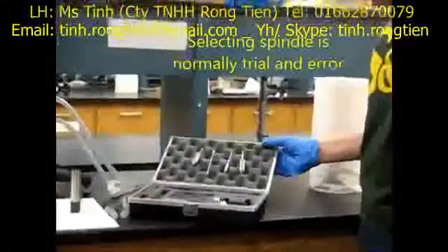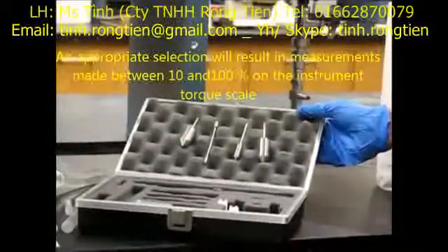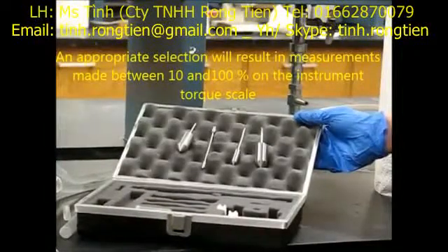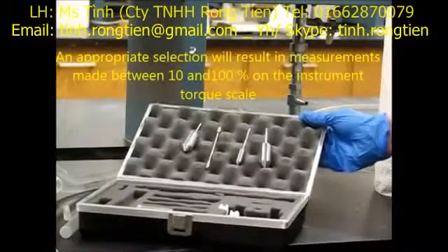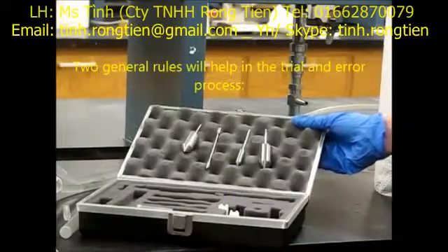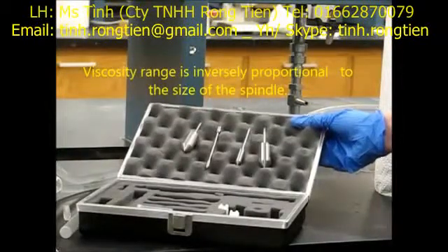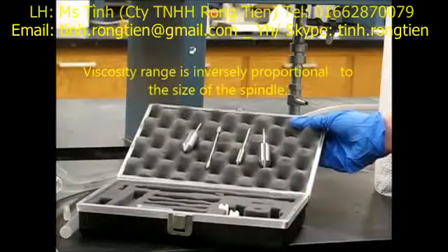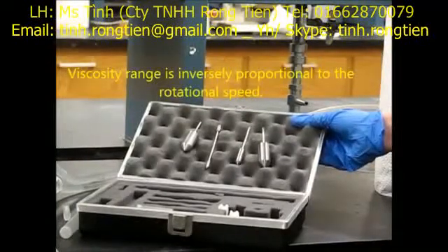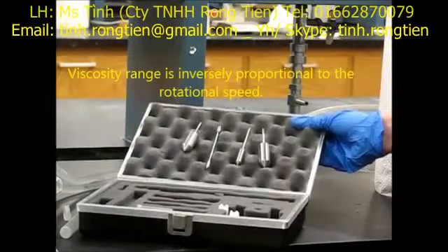Selecting a spindle is a trial and error process. An appropriate selection will result in measurements made between 10 and 100 percent on the instrument torque scale. Two general rules help in this process: first, viscosity range is inversely proportional to the size of the spindle; and second, viscosity range is also inversely proportional to the rotational speed.